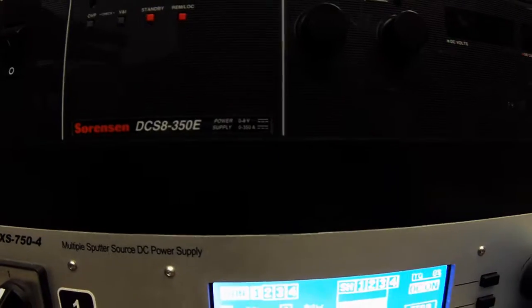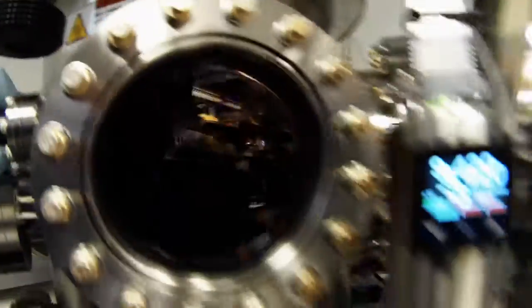Now that the plasma is fired up, we can change the power by pushing the dial - let's put it up to 100 watts. You can see the color slightly changes when you do that. The more power you put on the sputter gun, the faster it's going to sputter. More gas in the chamber also increases sputter rate because there are more gas molecules turning into plasma and impacting the target. However, increasing gas pressure decreases the mean free path, resulting in more non-uniform coverage on your substrate - so you get faster deposition but less uniform coverage.